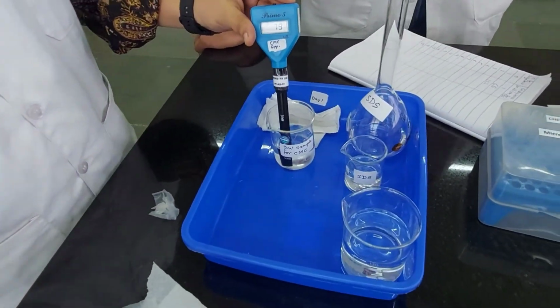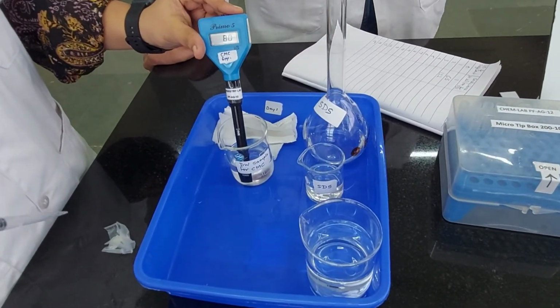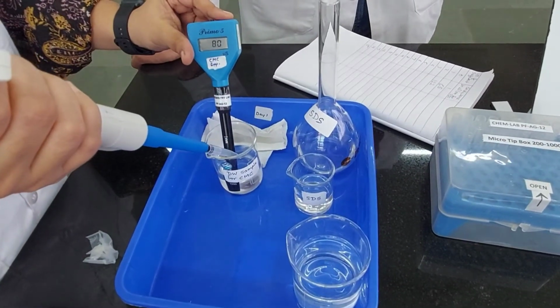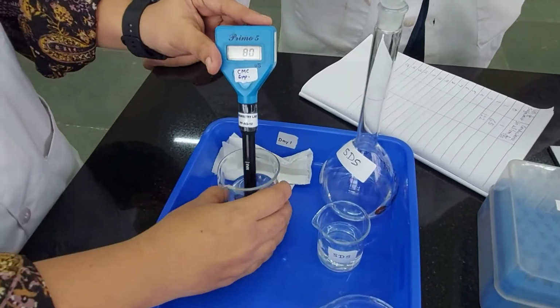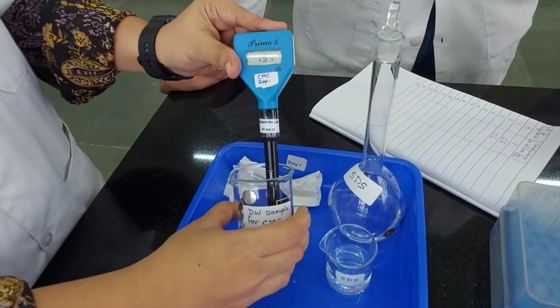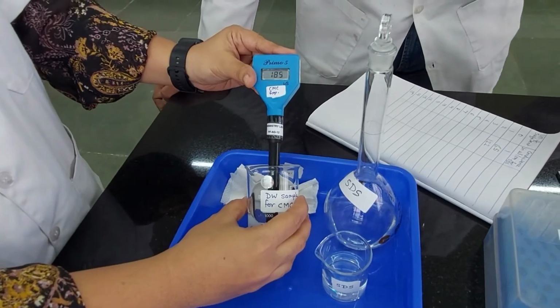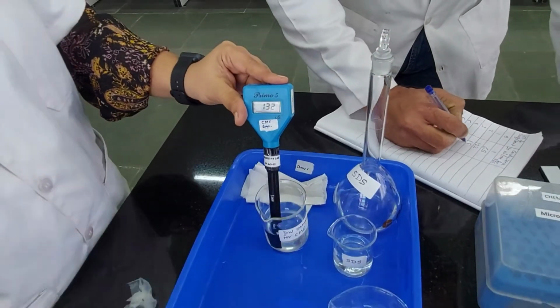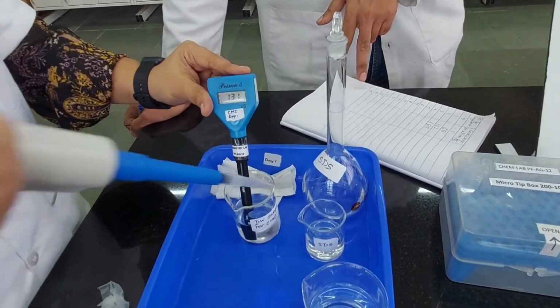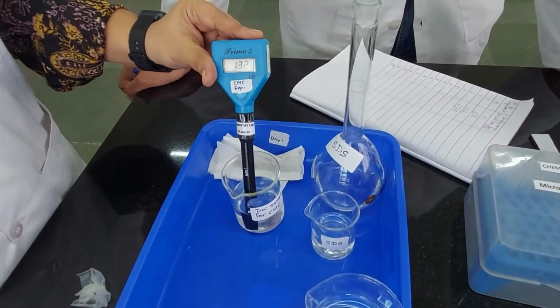Now let's move on with the third milliliter into the system. Yes, there it goes. Mix it, and the reading says 185. That's the note I had made. If you see, it goes from 1 to 65 to 122 to 185, almost a 60 unit difference each time.